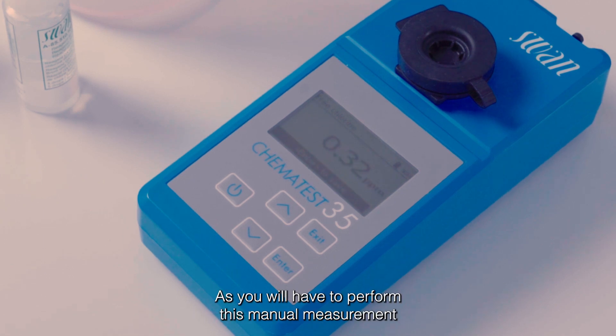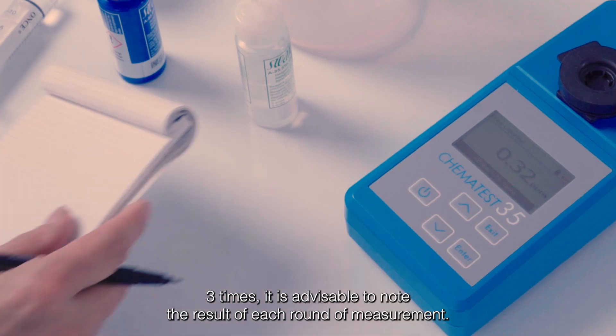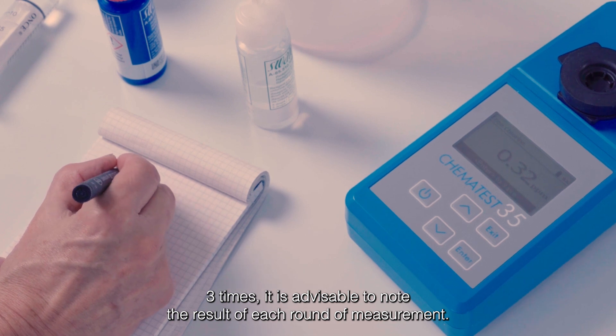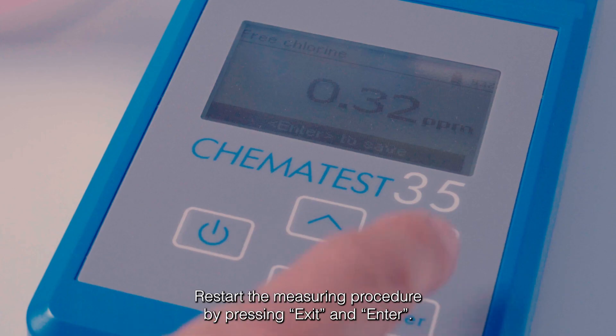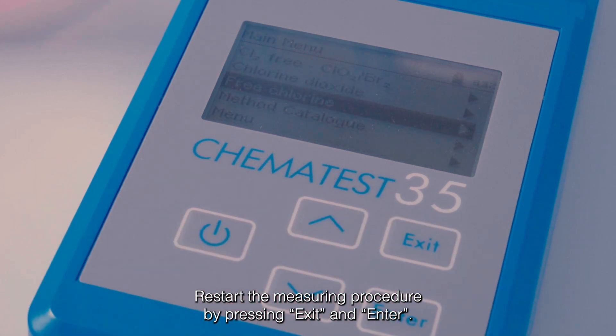As you will have to perform this manual measurement 3 times, it is advisable to note the result of each round of measurement. Restart the measuring procedure by pressing Exit and Enter.